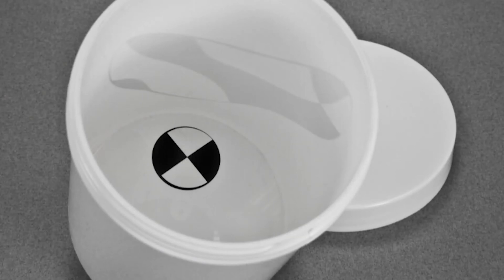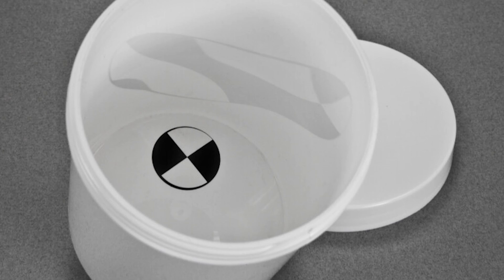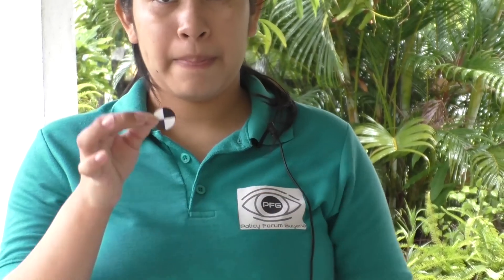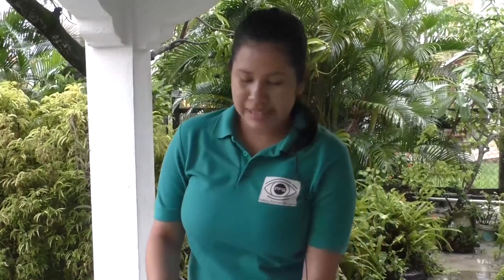Before beginning this test, I have emptied my jar and have my SecchiDisc sticker. It is best to stick the SecchiDisc sticker 8 to 24 hours before conducting the turbidity test. Step 1: remove the backing from the SecchiDisc icon sticker and adhere the sticker on the inside bottom of the large white jar, positioning it slightly off center.